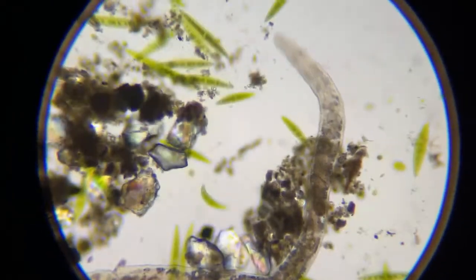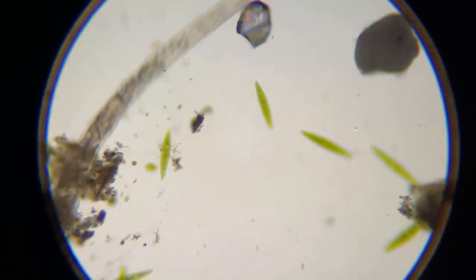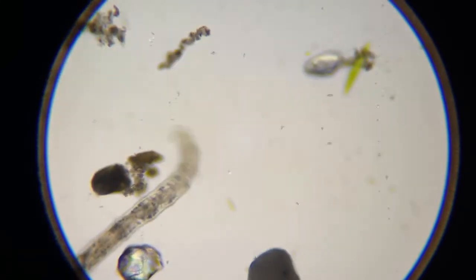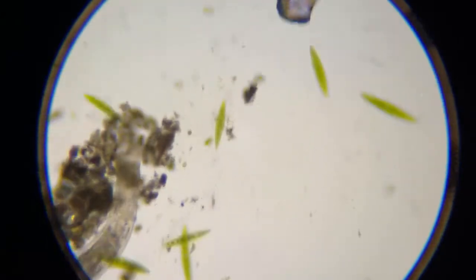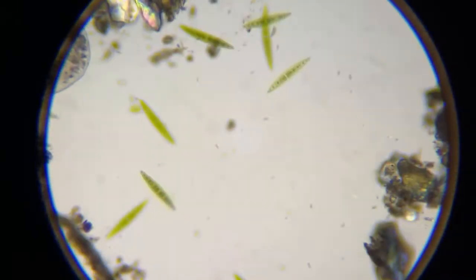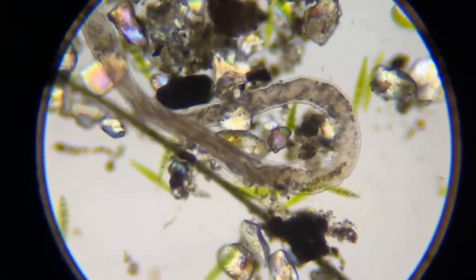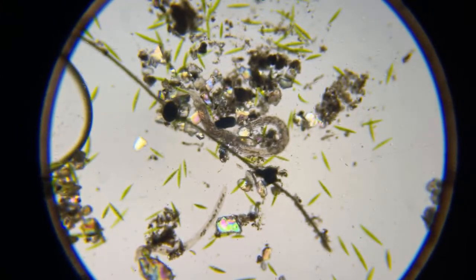Notice that he doesn't have a flat head, but he has segments. So this is an annelid also. Usually annelids are not poisonous. I mean, are not parasites. So he's a safe guy. But I'm not sure what he is. That's strange. I'm gonna have to look him up. Even I get surprised.